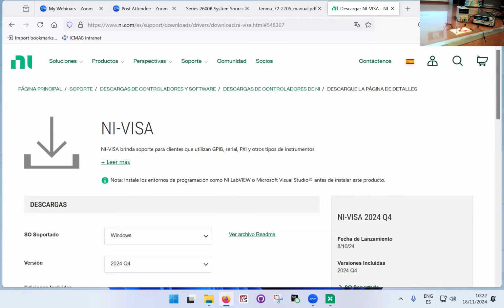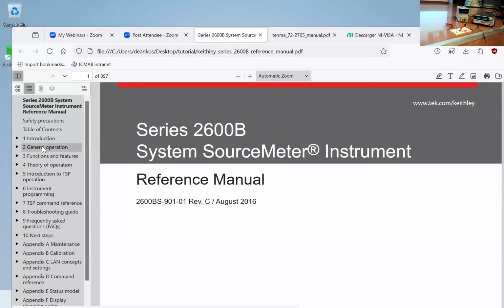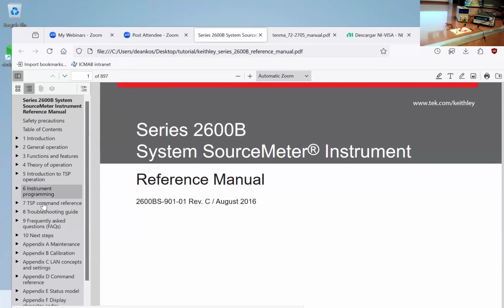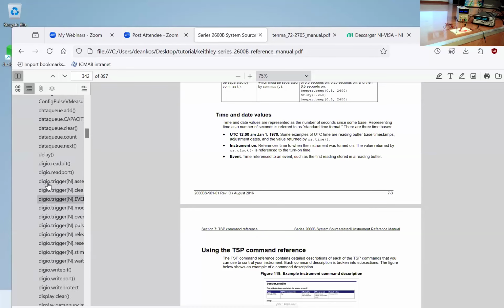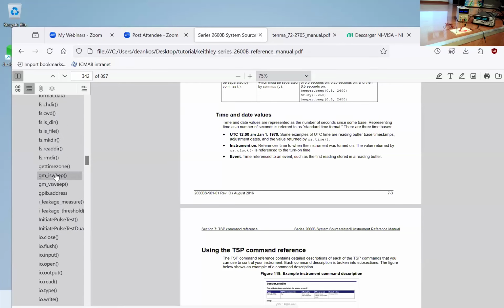Anyway, whatever. So you go and open your big fat manual of the instrument that you bought. This specific one has nearly 900 pages, so you need to know what you're looking for. I kind of know what I'm looking for because I've programmed this instrument several times, but what you're looking for is the command reference. And this is a list of all the commands that the instrument is able to take. In this particular case, all the Visa instruments actually have a few commands shared and common for all instruments that are compatible with the Visa standard.